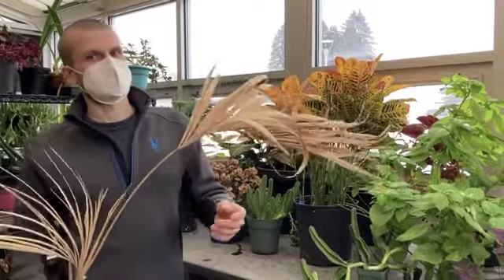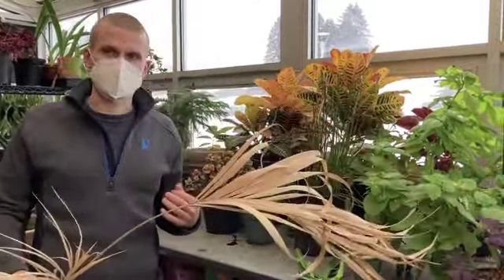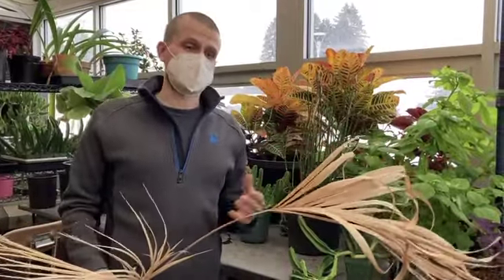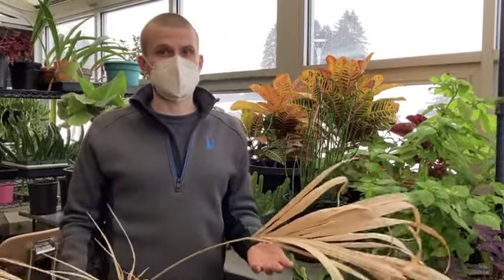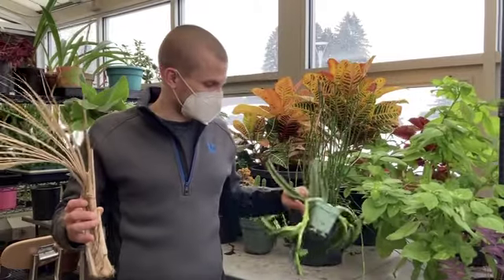All right, for our last section of the lab, we want to take a look at the macro scale things, a little bit of root architecture overall. And again, just like in our lab, we were comparing monocots and dicot roots in cross-section. We're going to finish the lab by comparing monocot roots and dicot roots in terms of their overall architecture.